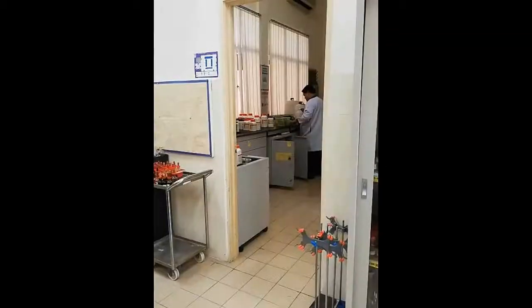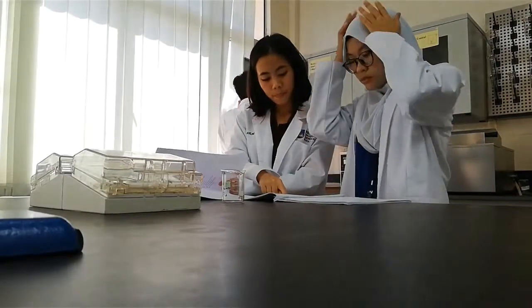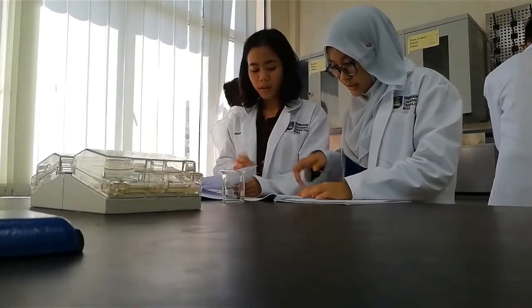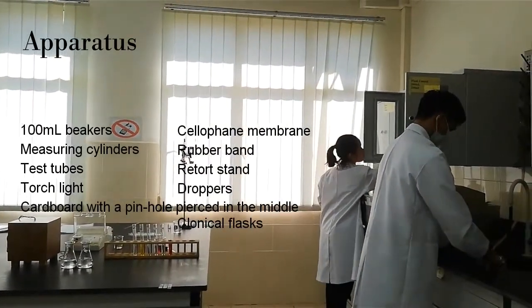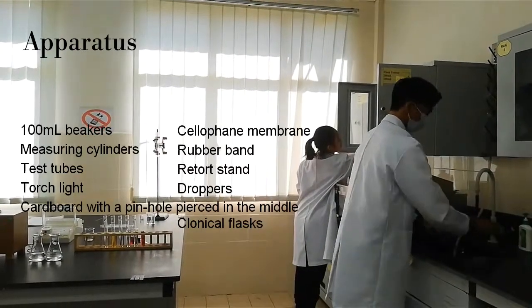The purpose of this experiment is to prepare a colloidal solution and observe its dispersion effect, to prepare gel, and to purify a colloidal solution through dialysis. We are preparing apparatus and chemicals that need to be used in this experiment.